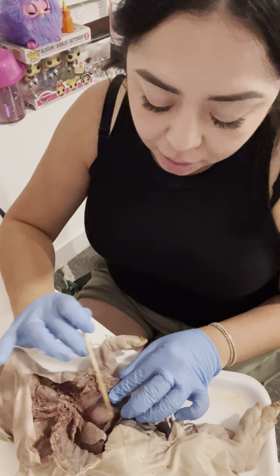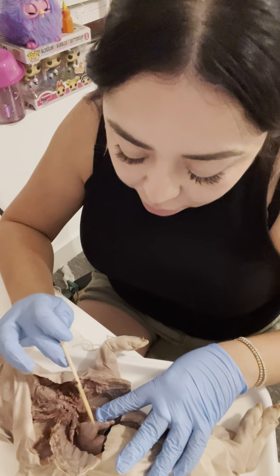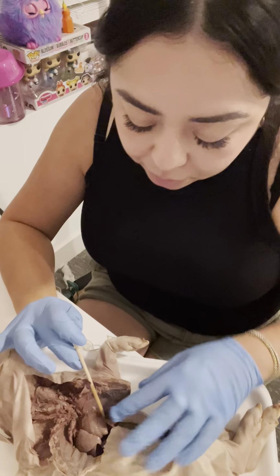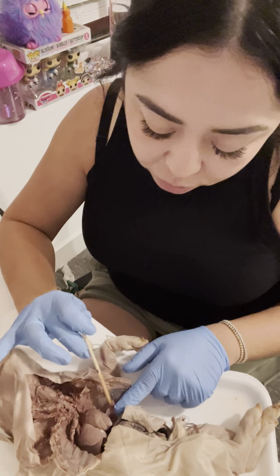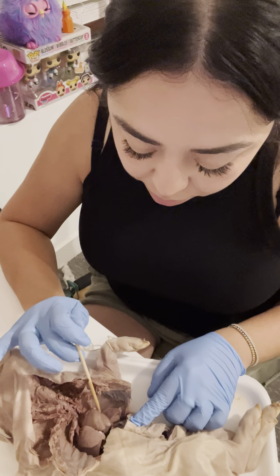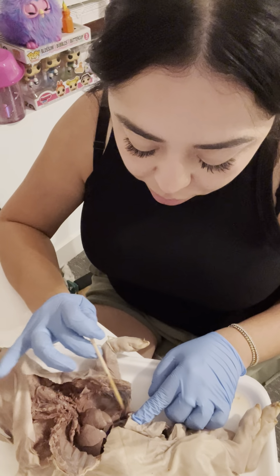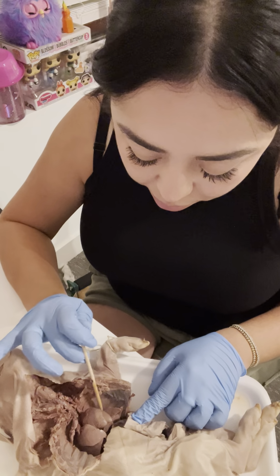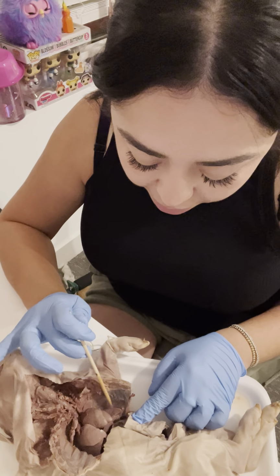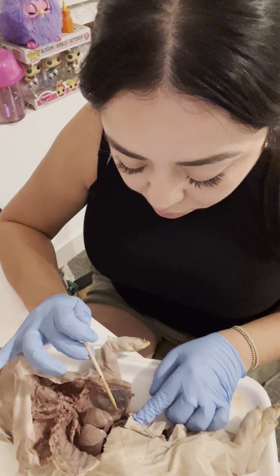And then if we go to the lobes, so we have the lobe here. So we have 2 pleura spaces in our lobe. So there's one here, and that would be the visceral pleura, right up here. And closer to the edge right here of the lobe, that would be the parietal pleura.